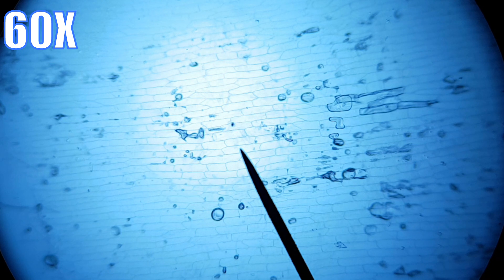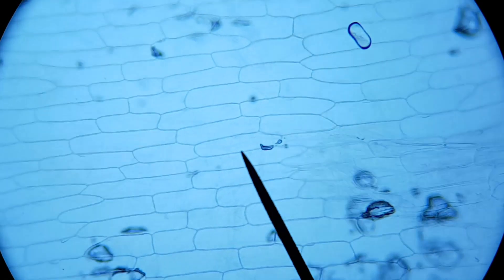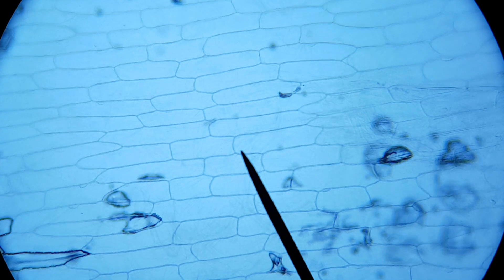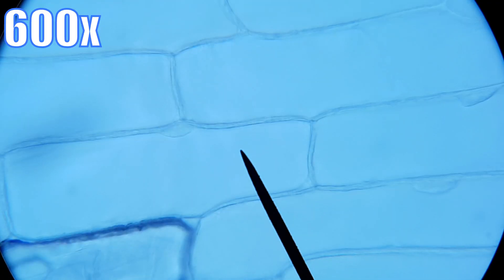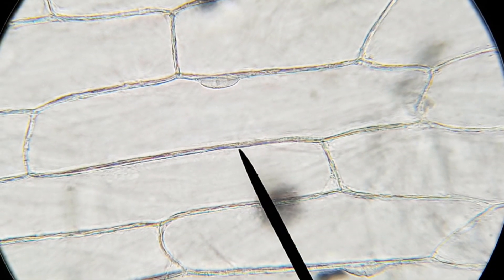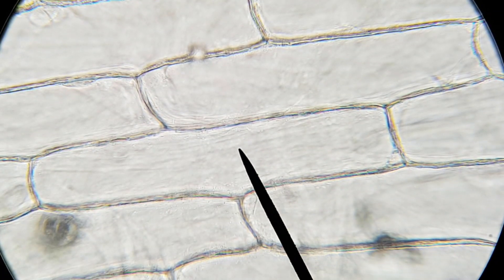This is a perfect example of a horrible microscope slide. You can already see plant cells present. What's interesting is that I don't see any nuclei — I'm not sure if there are supposed to be nuclei in the small onion piece I grabbed. Wait, actually that is a nucleus. What I like to show here is that you can see plant cells in plants even if you make the slide yourself rather than buying a prepared one, and it's really clear too.